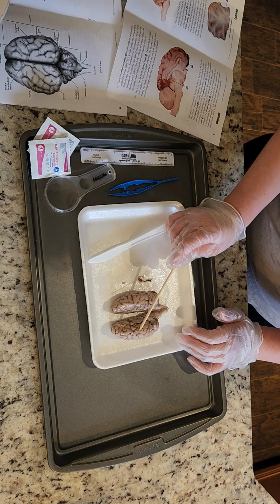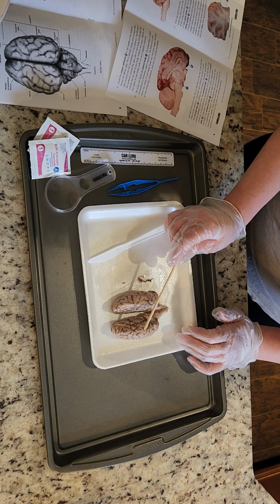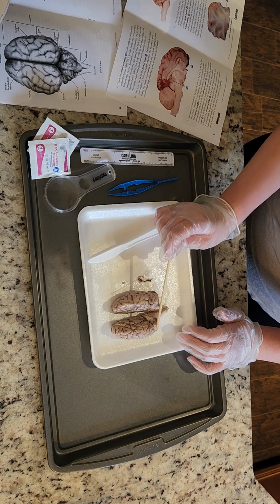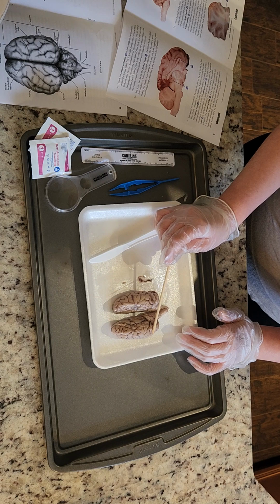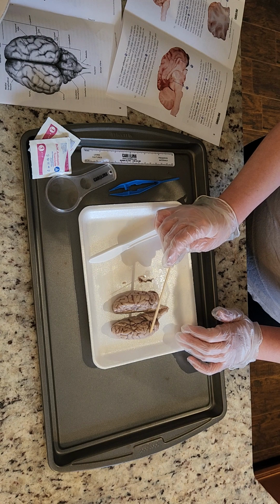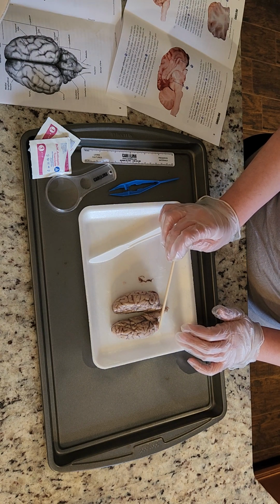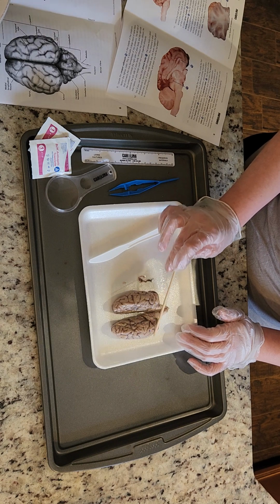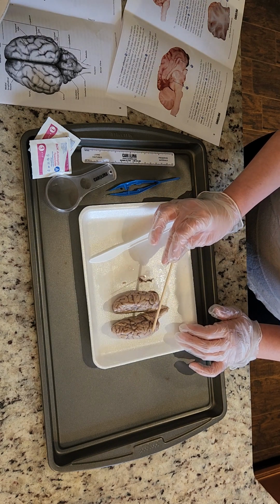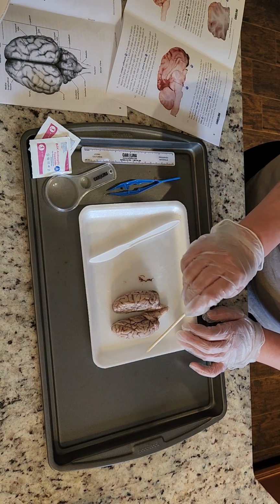It's recognition and movement, and then the occipital lobe. Sorry, I'm trying to say it right. Occipital lobe, which is back here. Yes, right here. It's behind here. It's responsible for vision. So yeah, this is when we see things. This is part of the brain that helps us process that. And then we have our temporal lobe, which is right here.